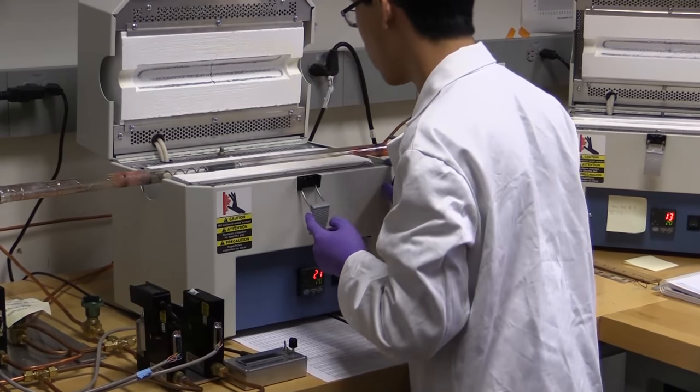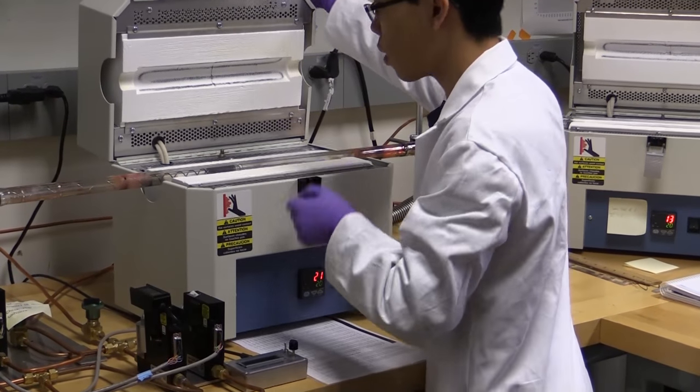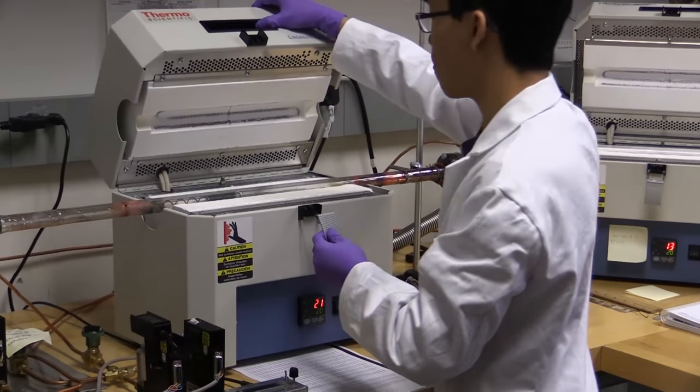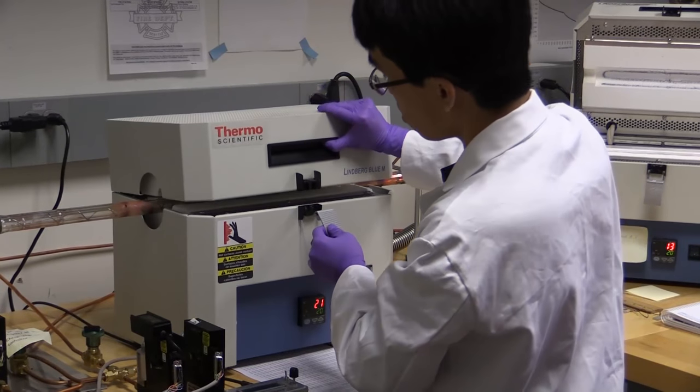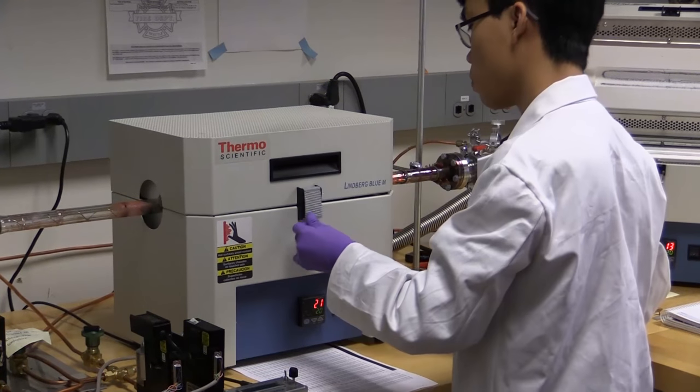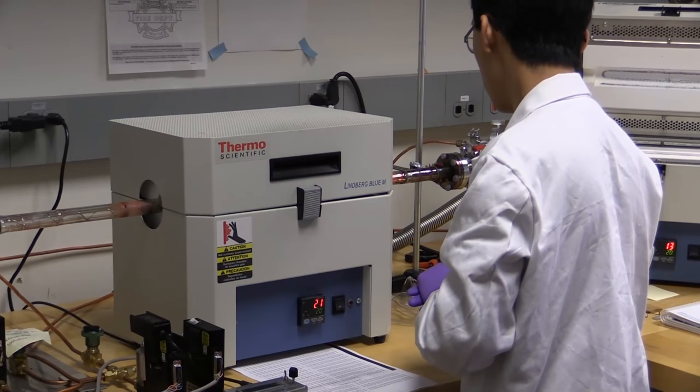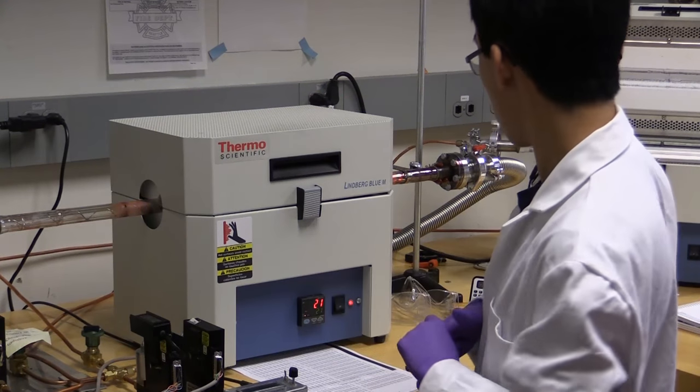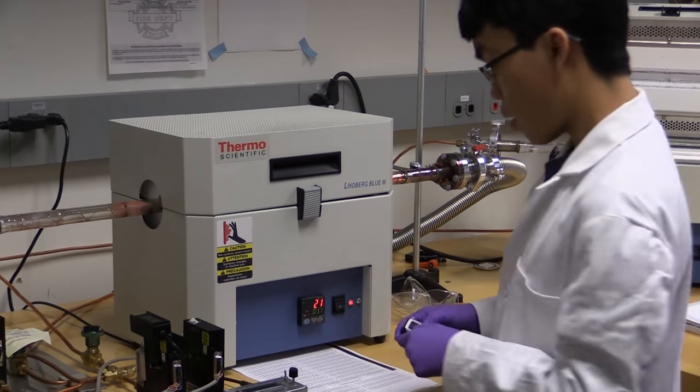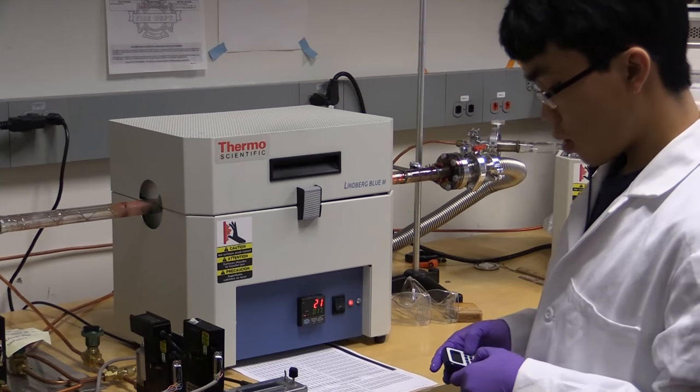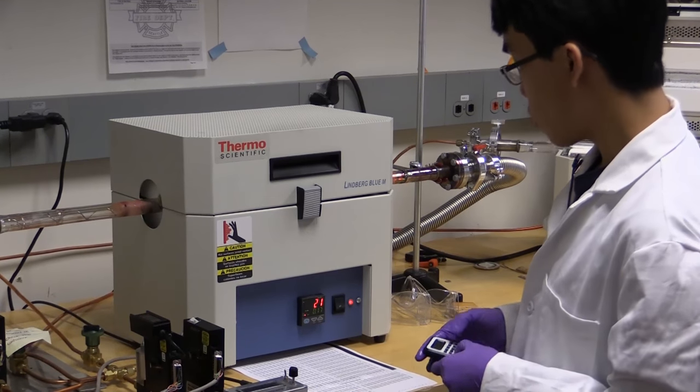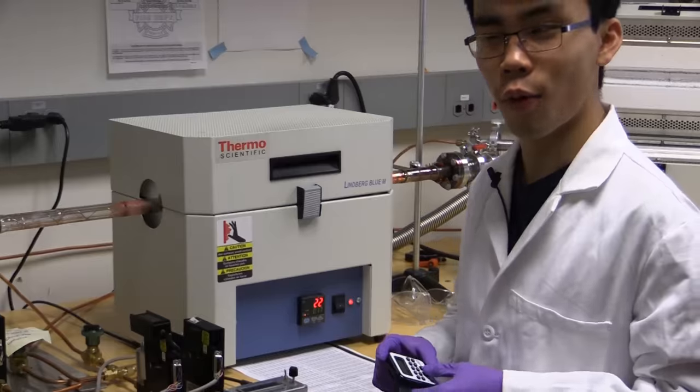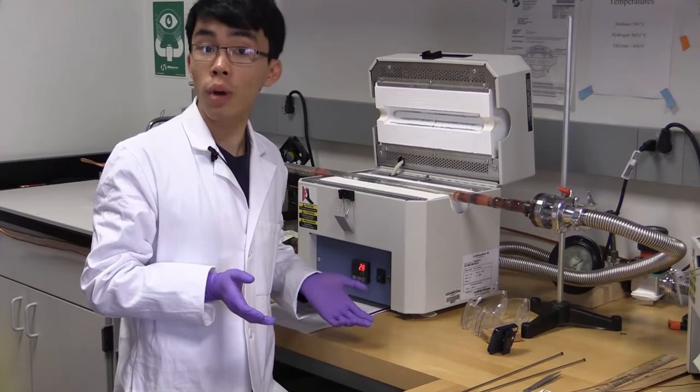Taking a moment to double-check that everything is in place. Chip is right in the middle, right where I want it. Crucible is still right-side up. I'll go ahead and close it up. Go ahead and turn on the furnace. Set our timer for just a little bit shorter than the furnace to set up for. Give us a little warning. So it's been two hours.